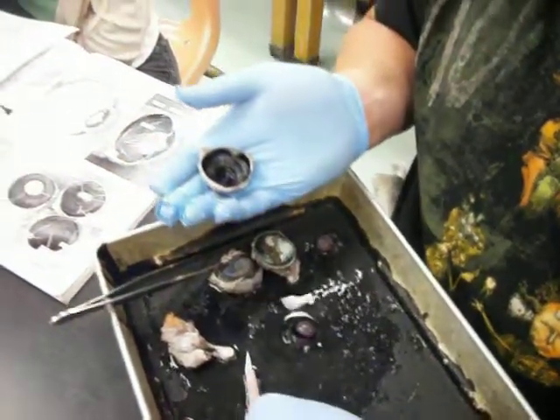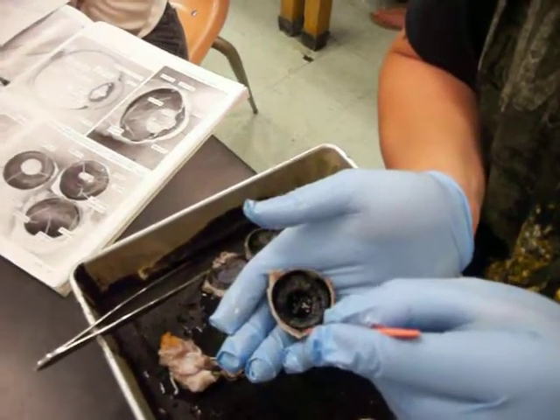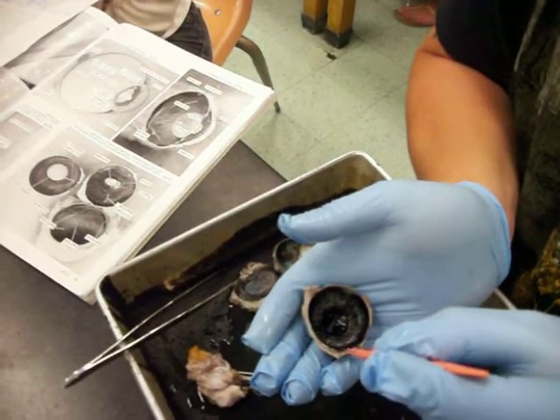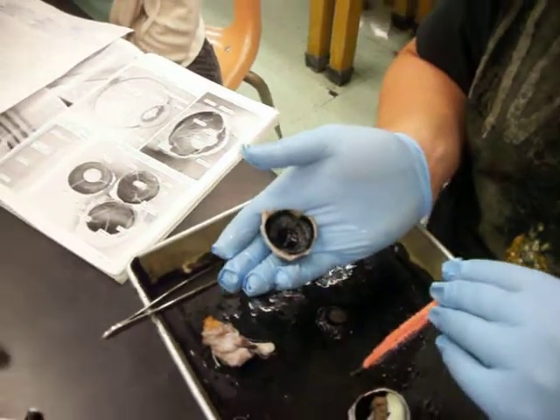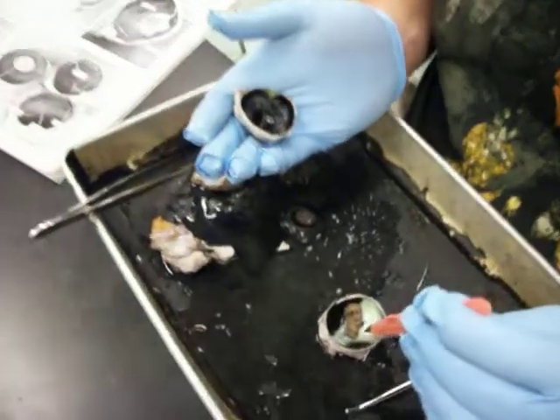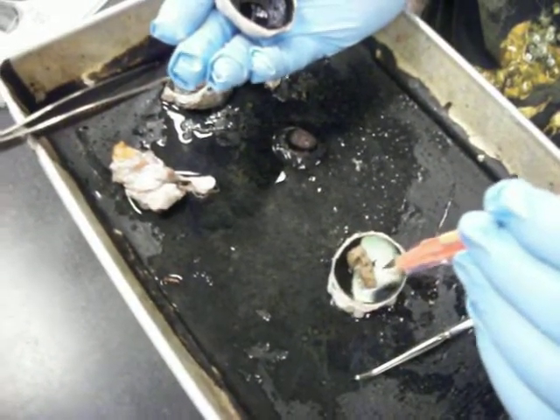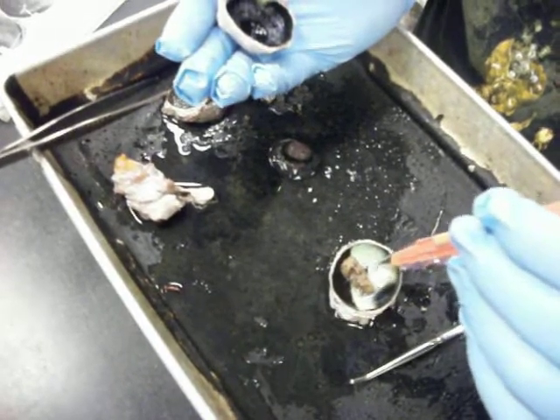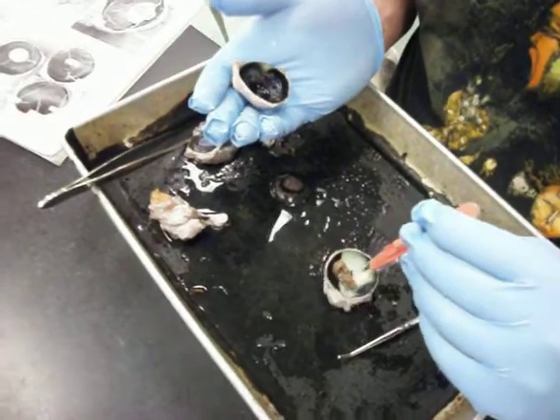Top black flap. We'll go right here, and I'll take this little knife and show it to you like that. Where that top part of the black flap is, that is known as the choroid layer. This pearly section that you see on the posterior side of the eyeball, on the inside of it, looks kind of like the inside of an oyster shell. That is your tapetum lucidum, or you can remember that as the pearl.